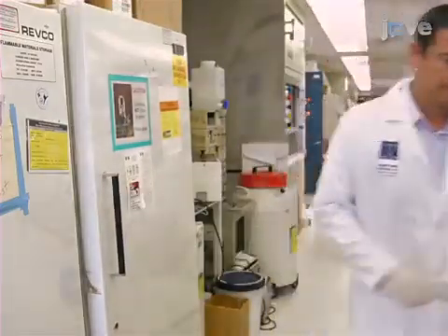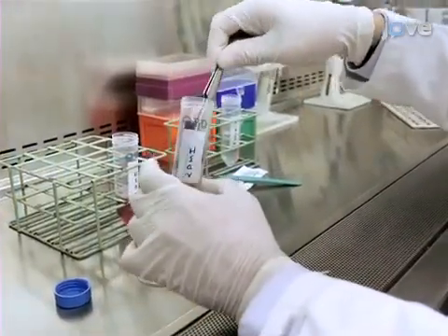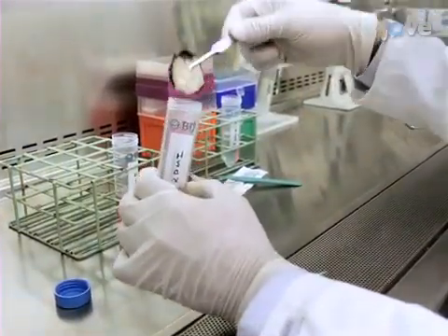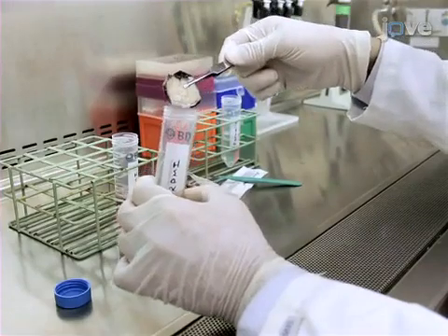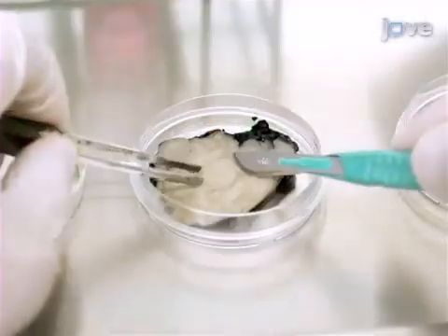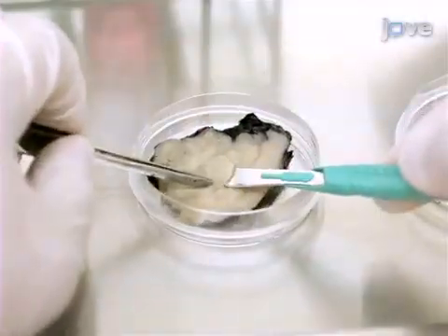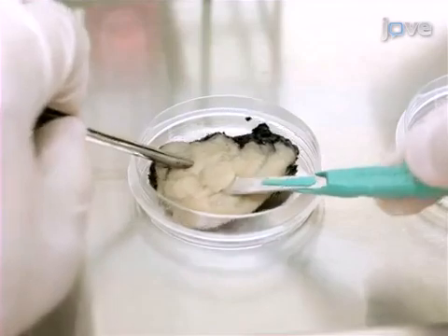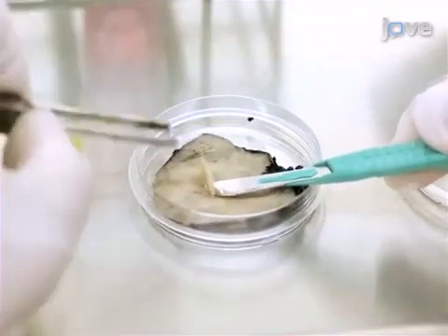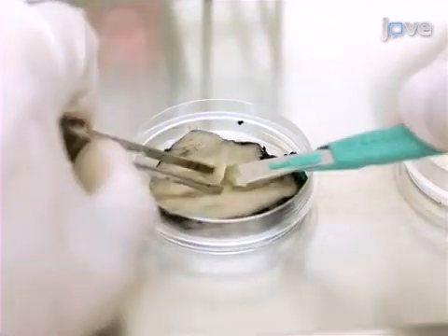Then, working in a biosafety cabinet with a sterile scalpel and forceps, obtain 2-4 mm thick horizontal tissue sections from the macroscopic tumor nodules within the cancer tissue sample.